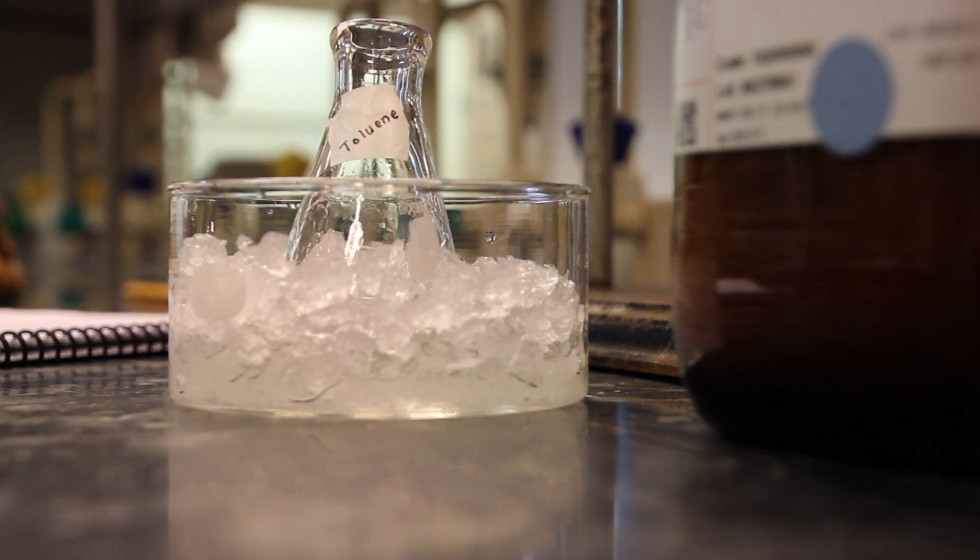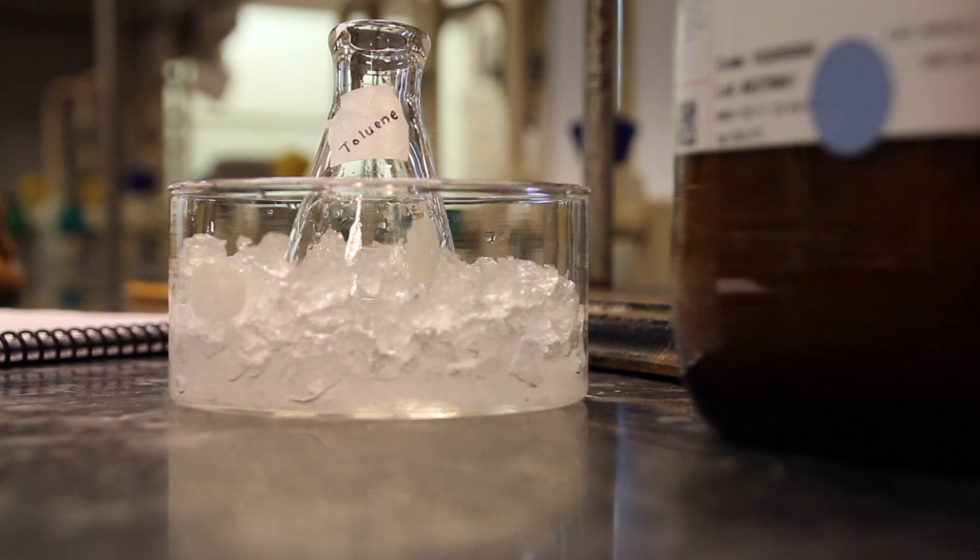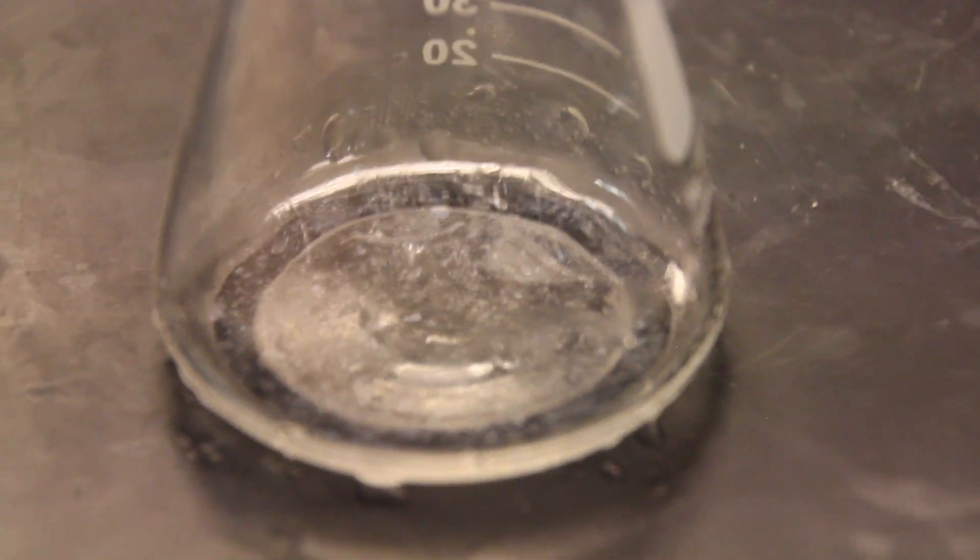To do so, place your test tube in an ice water bath. If crystals appear, you have found a suitable solvent and may move on to the next step.